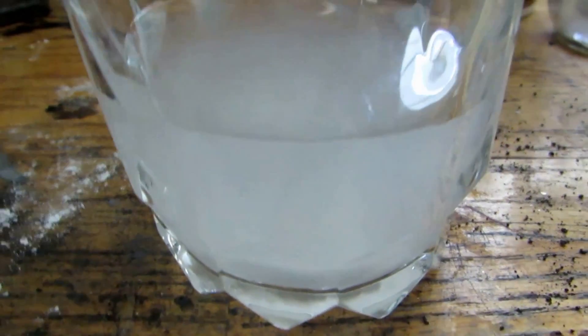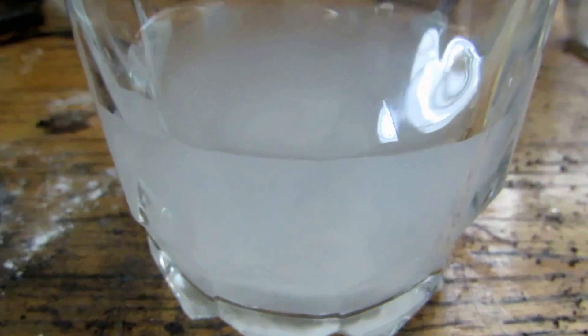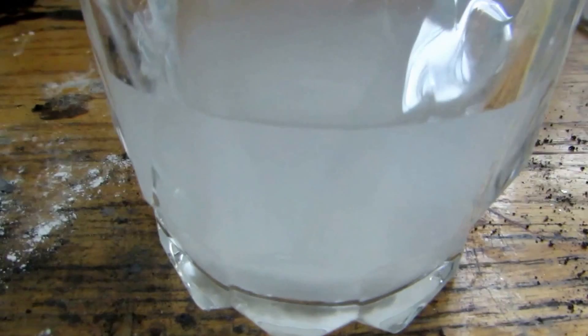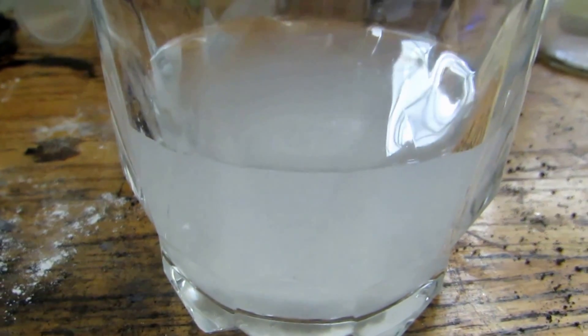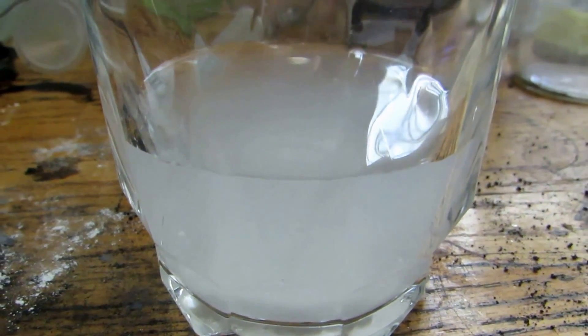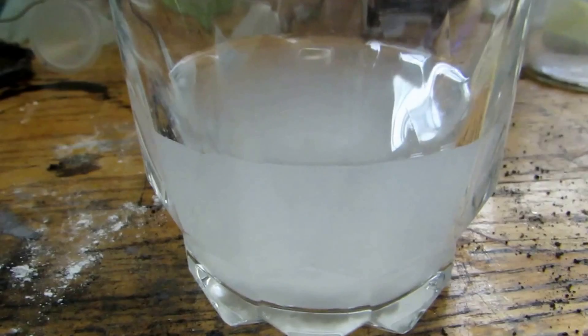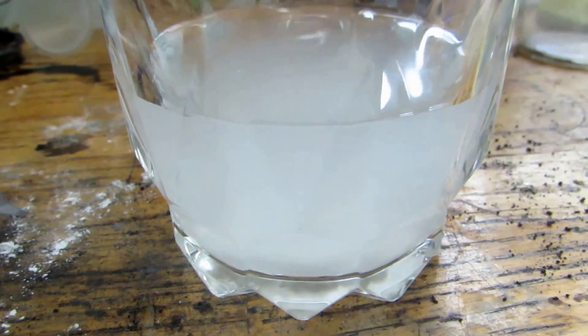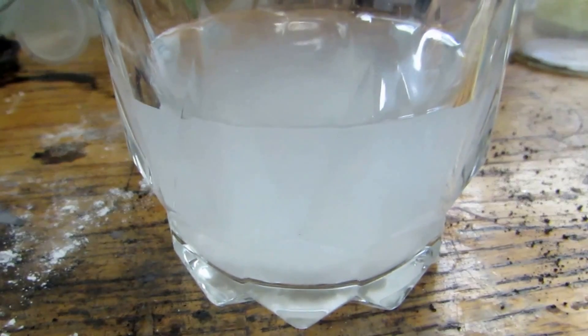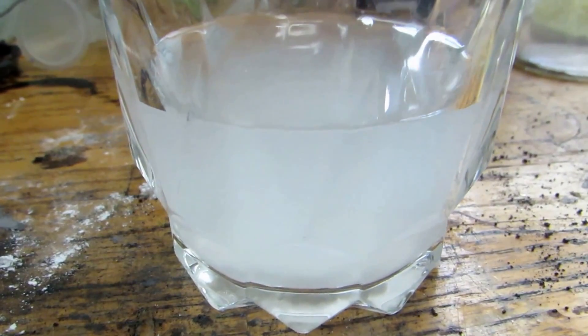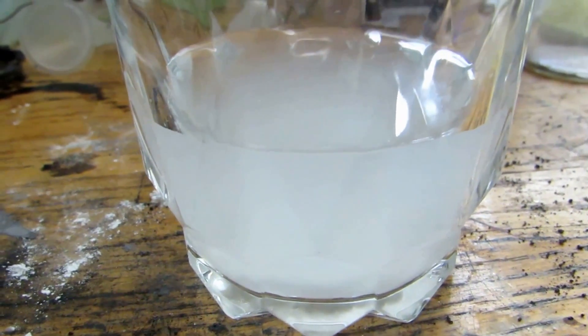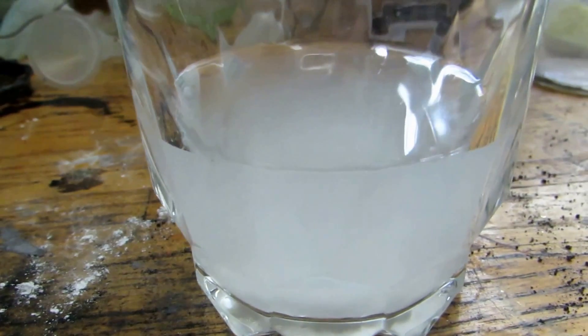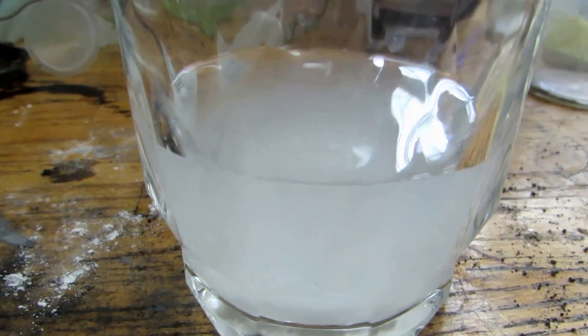Okay, so I went through all those fireworks and anything that burned with a bright red color, I put in some water. Now this is because I didn't actually do a flame test as much as I just simply set it on fire, which means there's a reaction happening and there's some other ingredients to make the strontium chloride react so that it can combust on its own. And I don't have a clue what they are, I tried to do research, couldn't find too much on it, so I just threw everything in water.